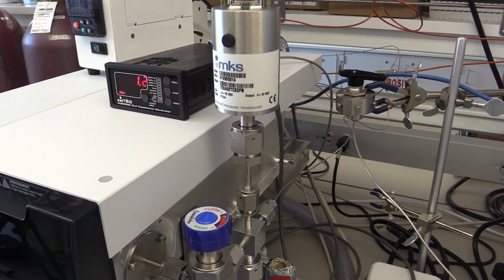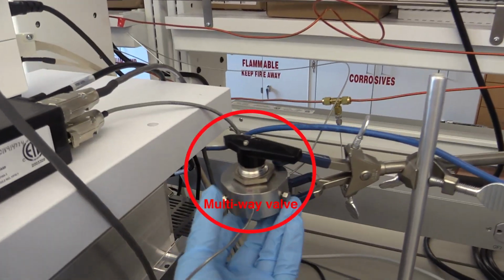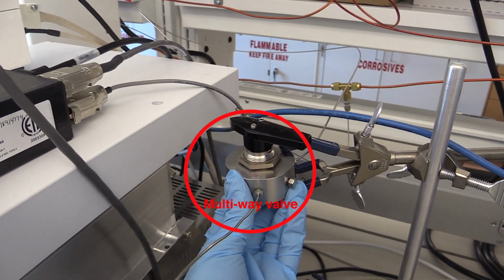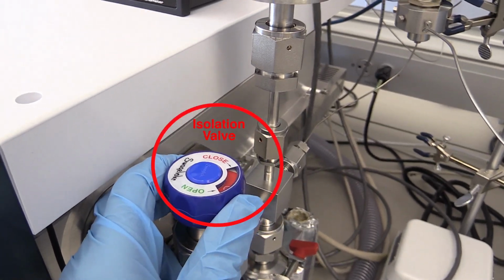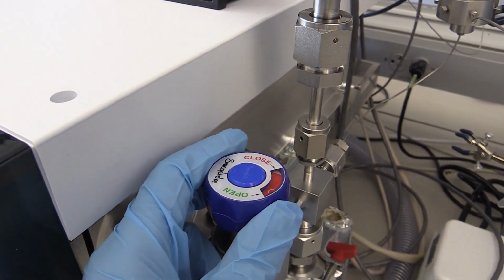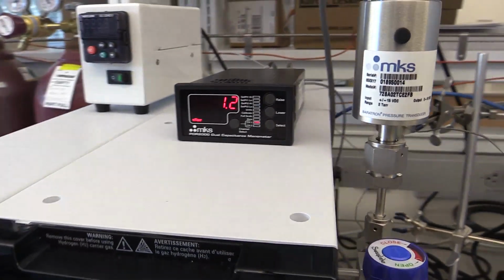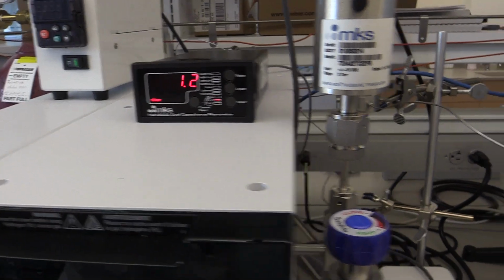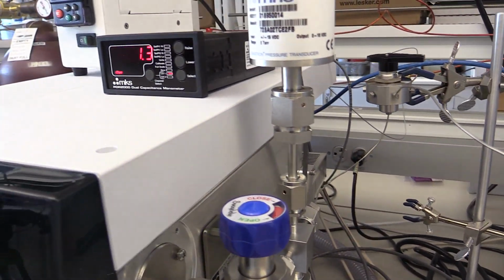A couple of main parts of the real-time gas analyzer are this multi-way valve over here, which is the sampling interface into the RTGA, and then this isolation valve, which is what allows your sample to enter the mass spec, but it's also the last line of defense for protecting the mass spec. There's also this pressure sensor, which allows you to measure the pressure of the RTGA interface here and lets you know if you're flowing sample through or not.